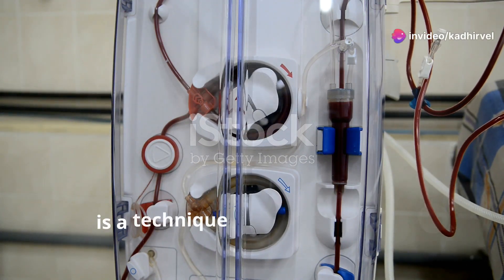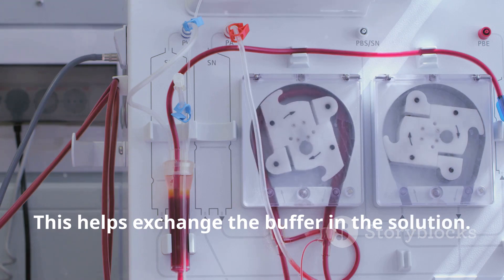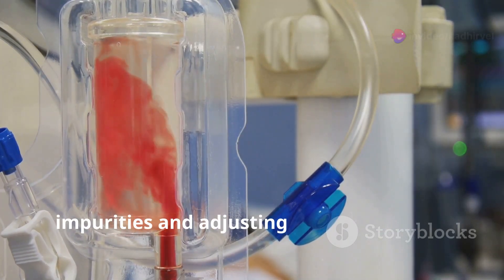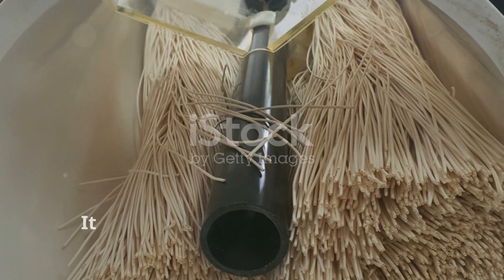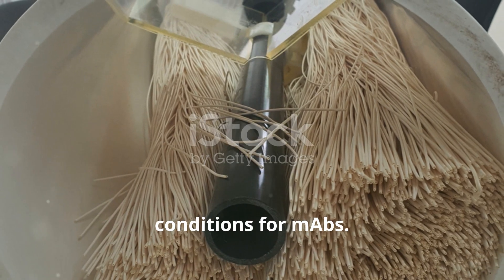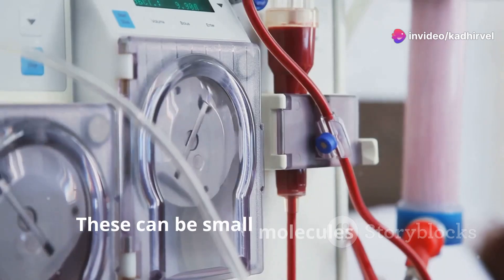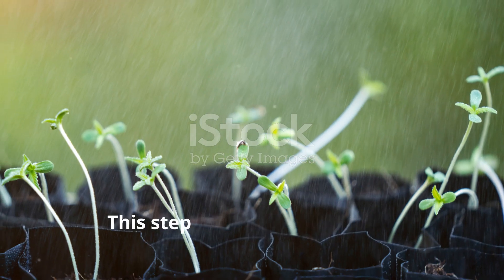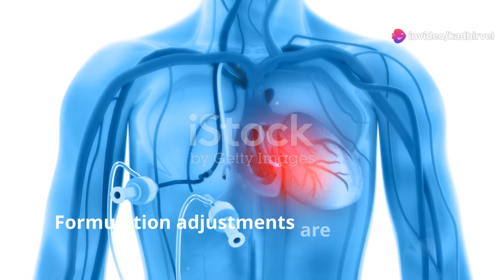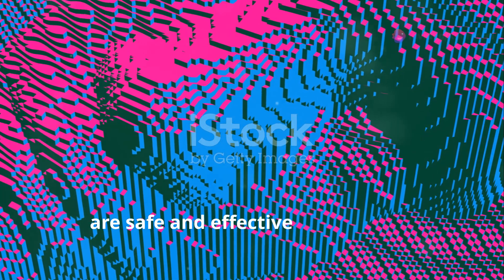Diafiltration, or DF, is a technique used alongside UF. It involves adding a buffer solution while filtering, which helps exchange the buffer in the solution. DF is crucial for removing small impurities and adjusting the formulation. In MABs production, DF helps with buffer exchange — replacing the existing buffer with a new one — which is essential for achieving the right conditions for MABs. Buffer exchange can affect the stability and efficacy of the antibodies. DF also helps in removing small molecules or salts that UF cannot remove, ensuring a cleaner product. Formulation adjustments are another key purpose of DF, allowing manufacturers to fine-tune the MABs solution by changing the pH or ionic strength, ensuring that MABs are safe and effective for patients.